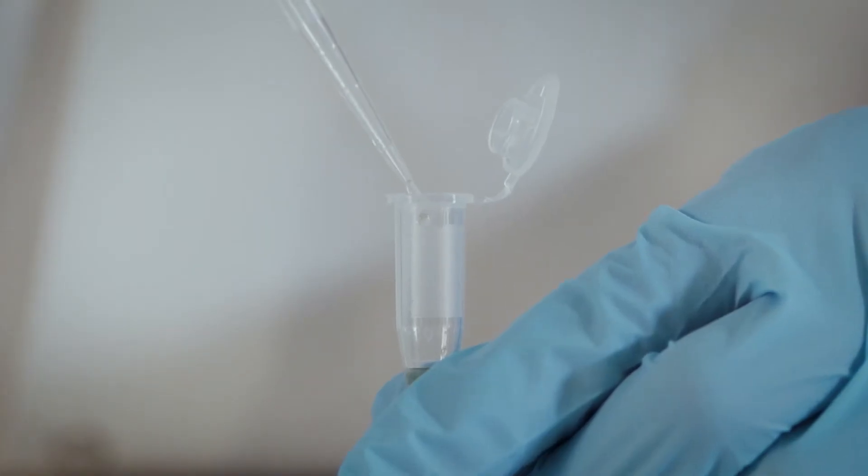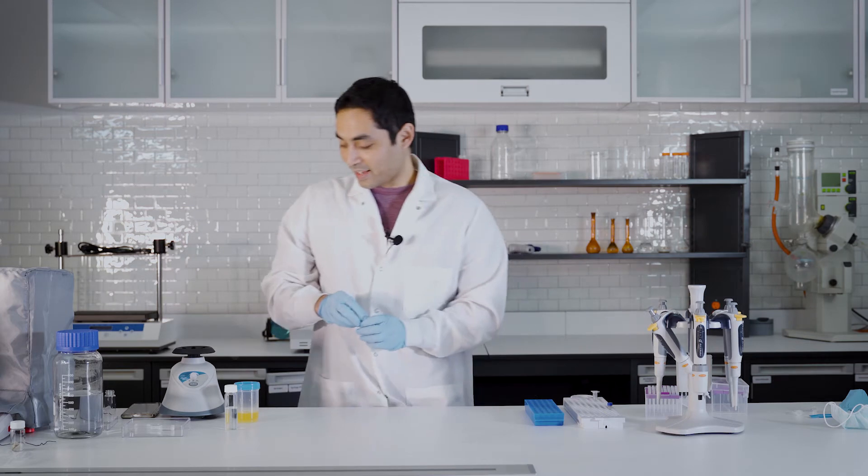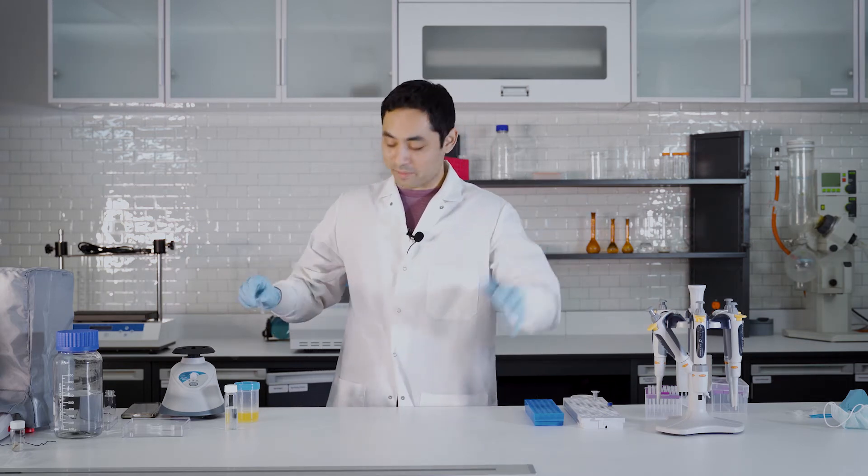So we're gonna add it in there and then we're gonna vortex this guy probably for about a minute.